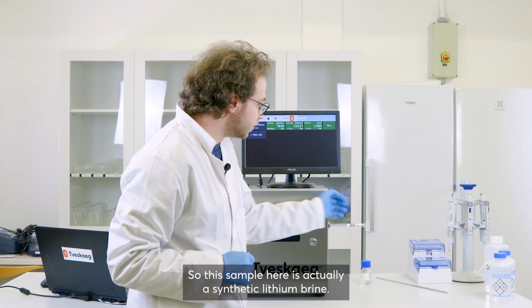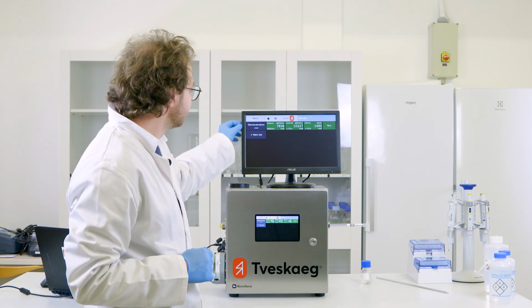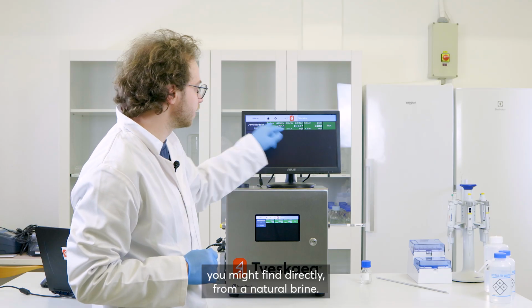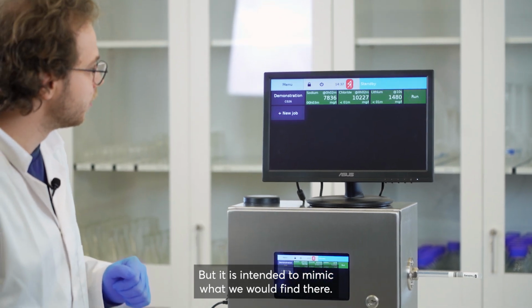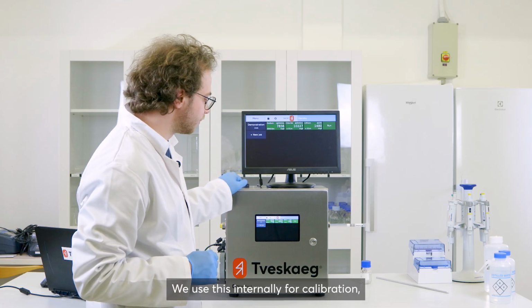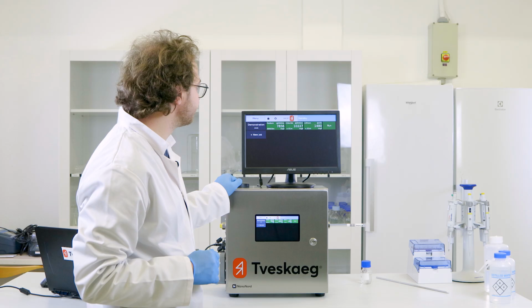This sample is actually a synthetic lithium brine, not quite as concentrated in sodium and chloride as what you might find directly from a natural brine, but it is intended to mimic what we would find there. We use this internally for calibration, but this is right around what we would expect.